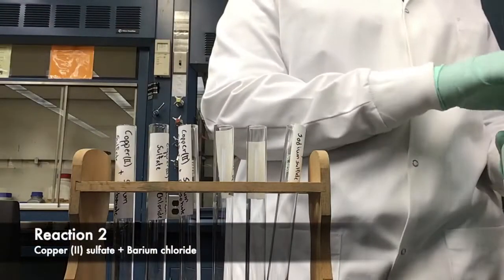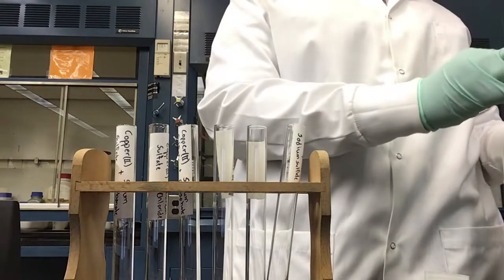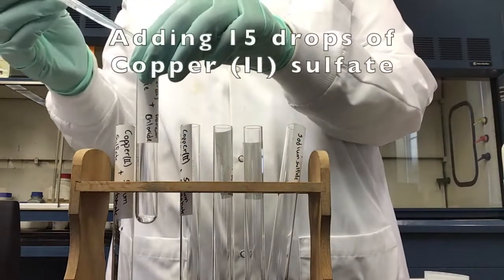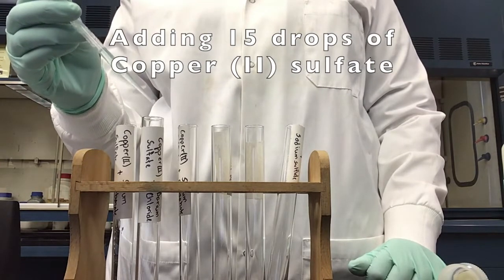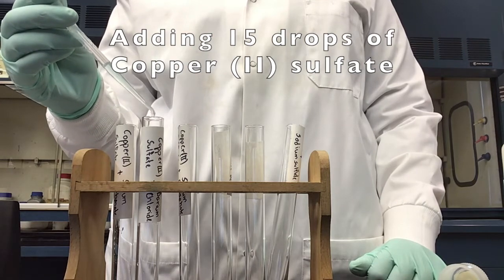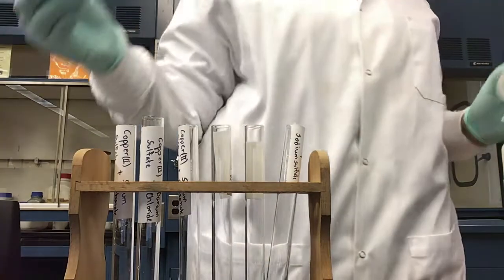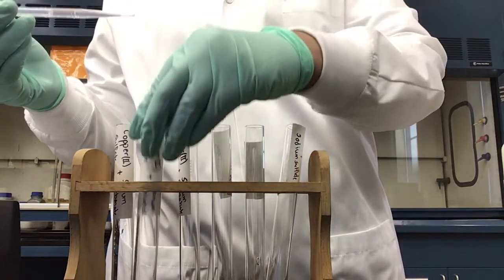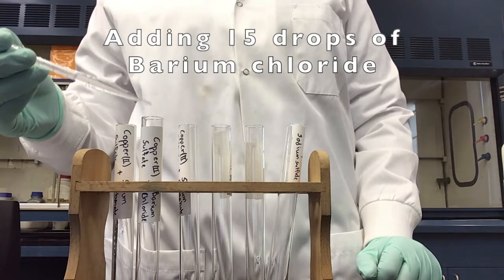Our second reaction today is copper 2 sulfate and barium chloride. We're going to start off by adding 15 drops of copper sulfate to our second test tube. Next, we're going to add barium chloride to our copper 2 sulfate in our test tube.